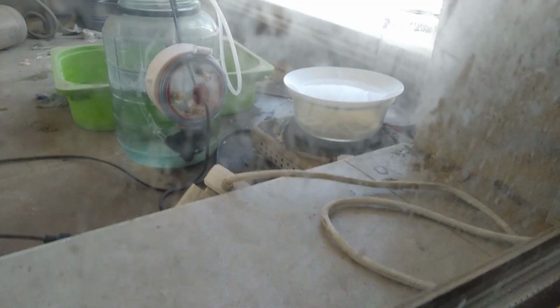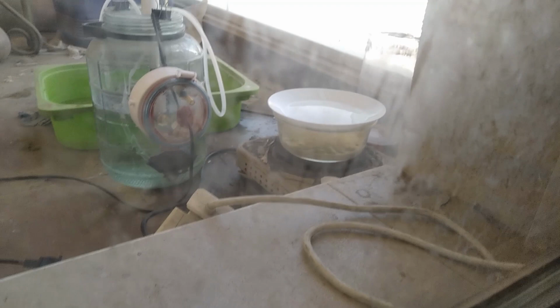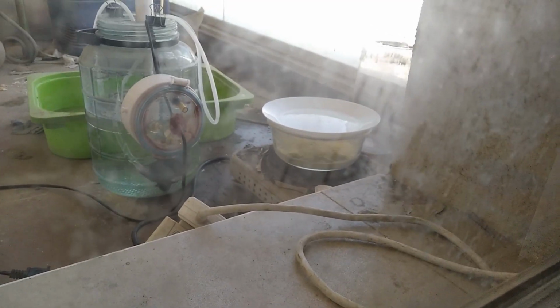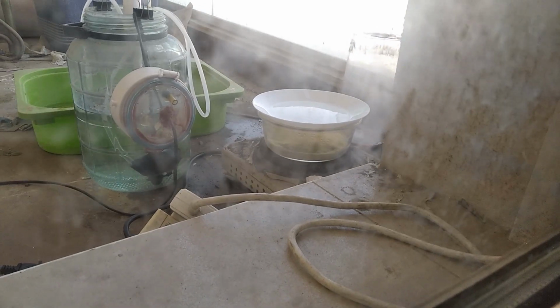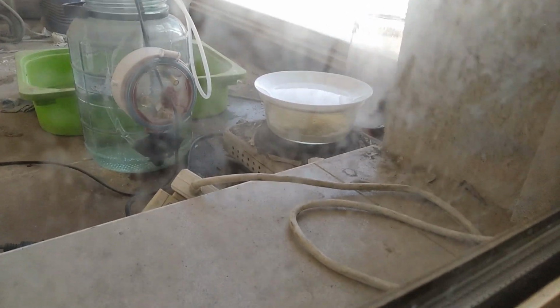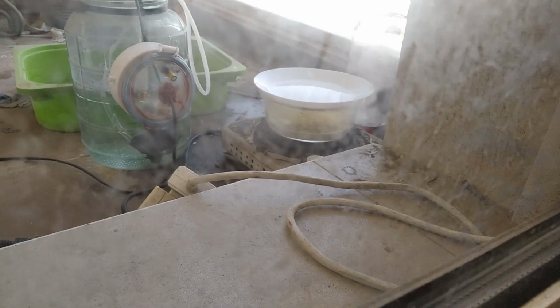So over here through this door, it's a tin lead alloy, which is why this is in a closed door. After this reaction calms down, the heating is not turned up. But that's a good thing because I don't want the heat to be turned up. Once this is dissolved, the metastannic acid will then be filtered out and reacted with hydrogen chloride.